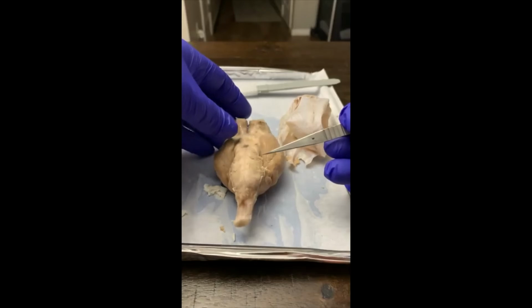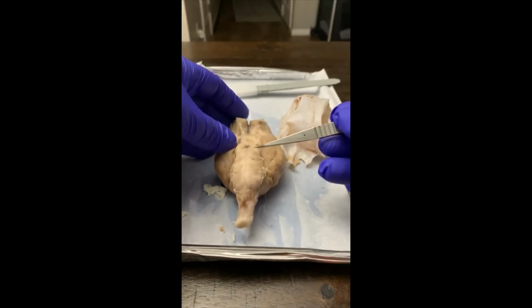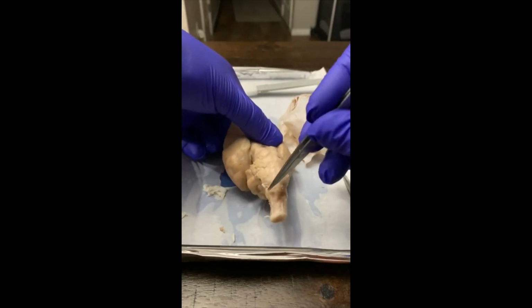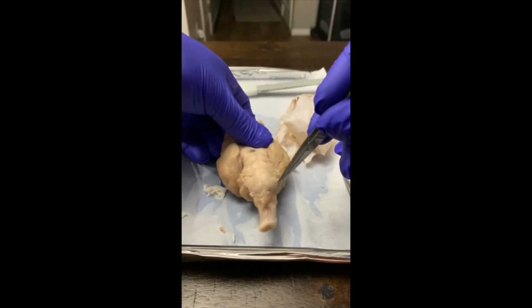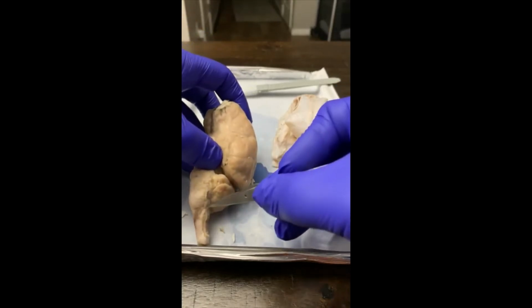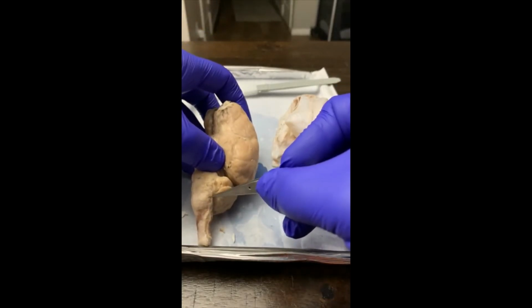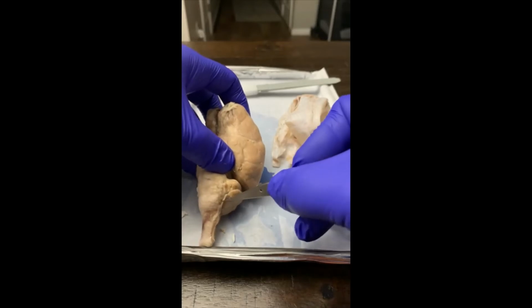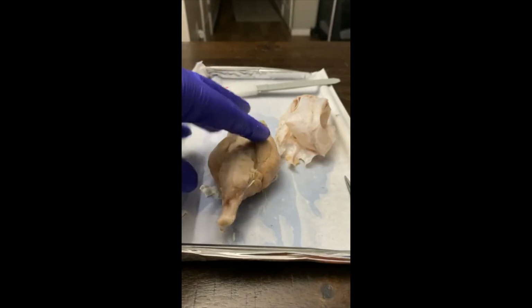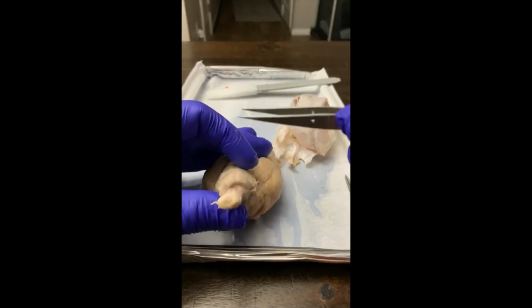I dissected it off. And then cranial nerve number 6, abducens, which I cannot really see. I'm not saying it's not here. It actually might be this little thing right here. That little nerve.